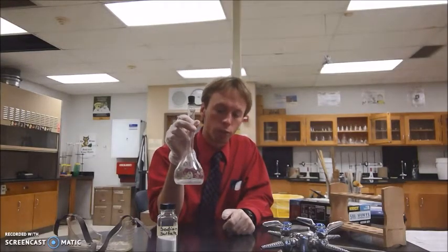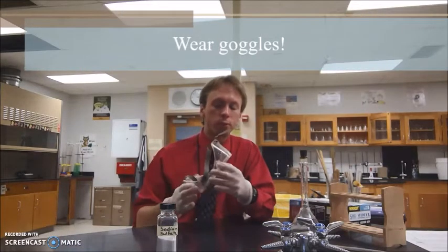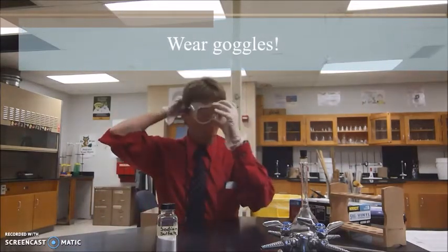You're also going to be working with a solution of calcium chloride. You'll see there's no hazard associated with that. But since we are working with chemicals and glassware and eventually we'll be using heat, we will, as always, be wearing our goggles.